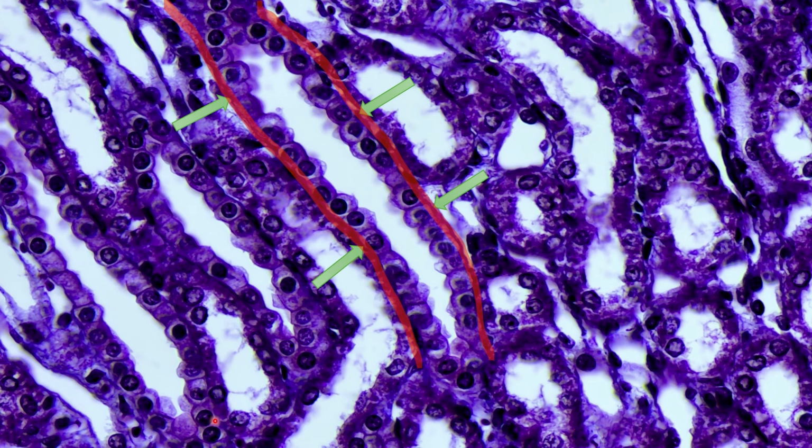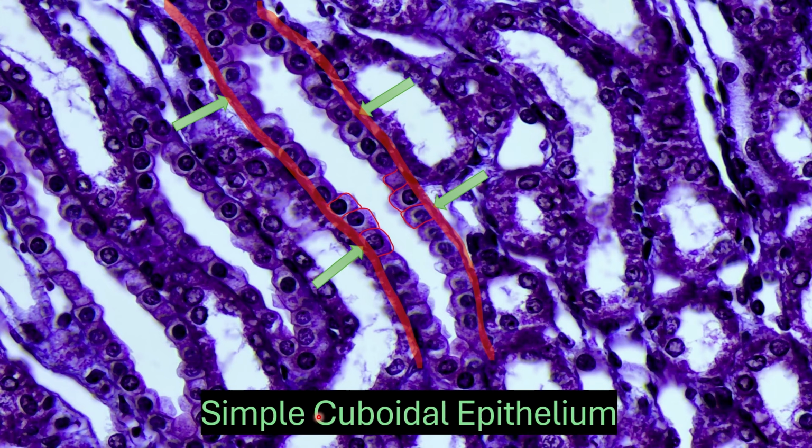So this particular slide comes from the kidneys where we have a bunch of different tubules or tubes, kind of like straws. So this one's in longitudinal section, this one's in cross section. Overall, we have a single layer of cells that are cube shape. Draw a few in just like this. On the cross-sectional one, the cell borders aren't quite as apparent. Overall, we have simple cuboidal epithelium. Single layer, cube shape.